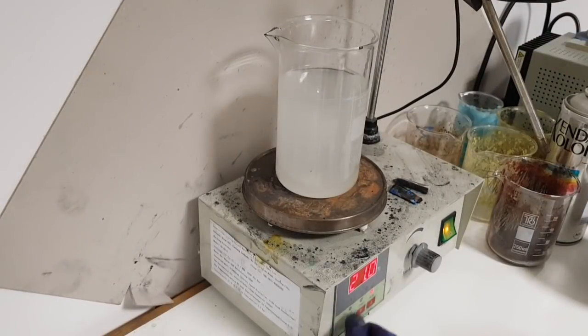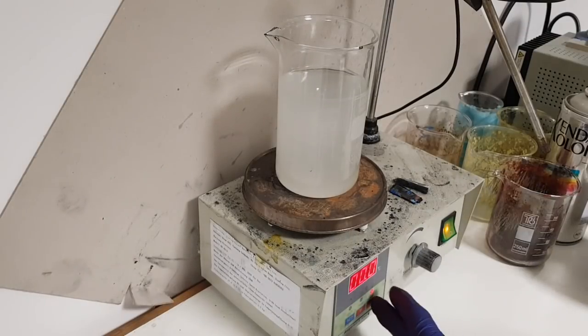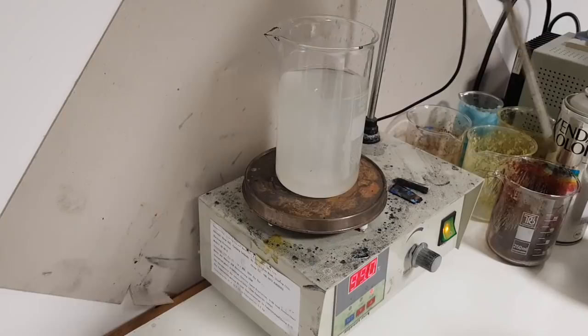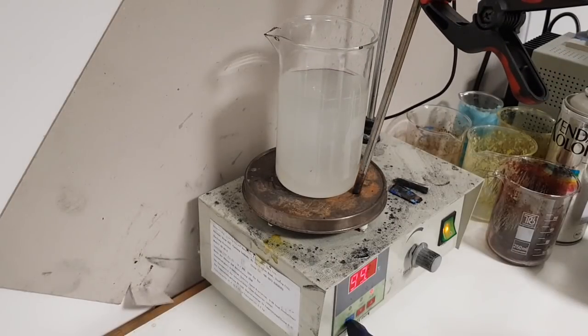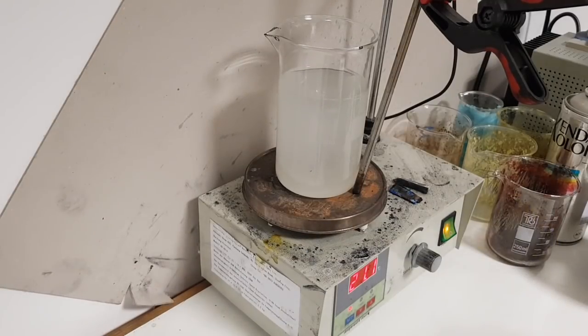And now you need to heat this solution to 90 degrees Celsius, 90 to 100 degrees Celsius. And now you need to leave it like this for some time.